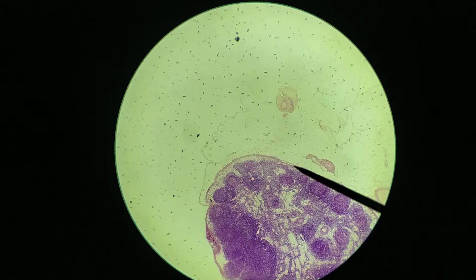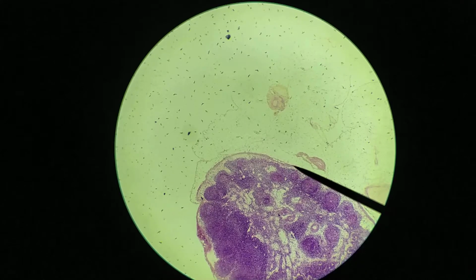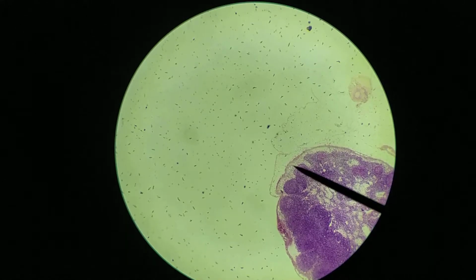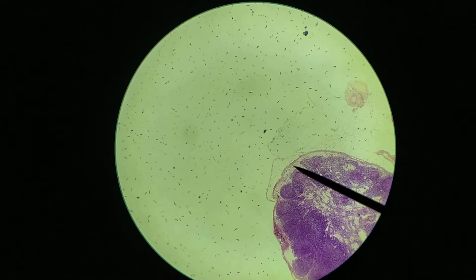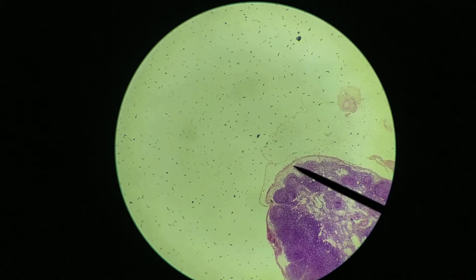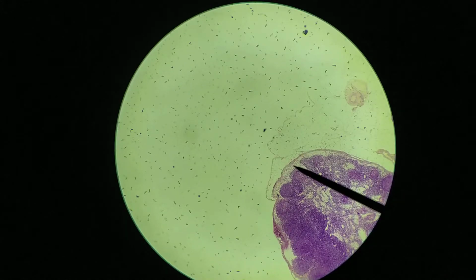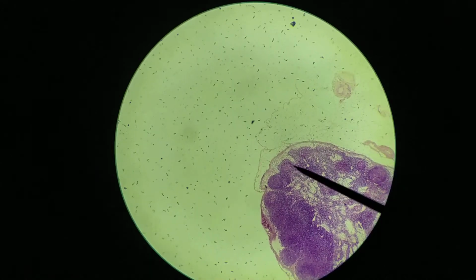They're coming from various parts of the nearby area, and they're going to be spilling their lymph into this lighter staining region just underneath the capsule. It's especially prominent here, for example. Okay, so this region right here, very poorly staining, fairly acellular, is called the subcapsular sinus because it's just below the capsule. Okay, so things spill out into this region here, and then the lymph, the fluid that comes in from the lymphatic vessels, will travel through this region right here where you see lymphatic nodules.